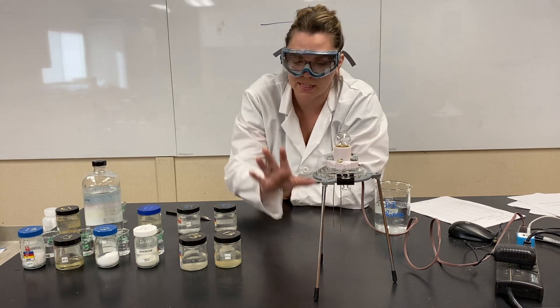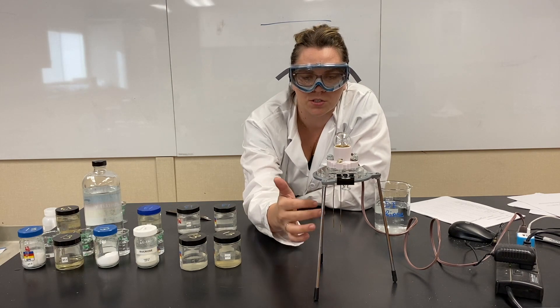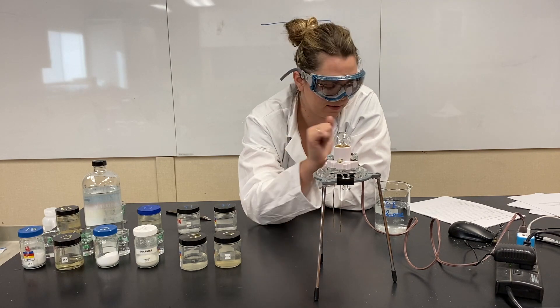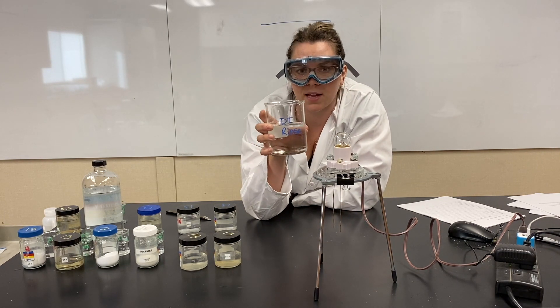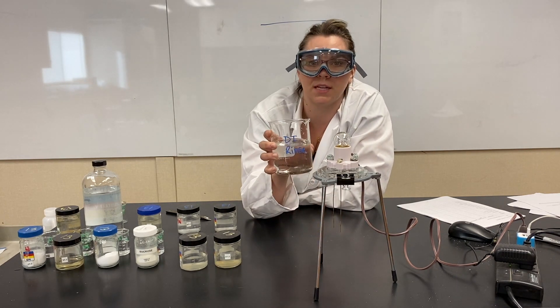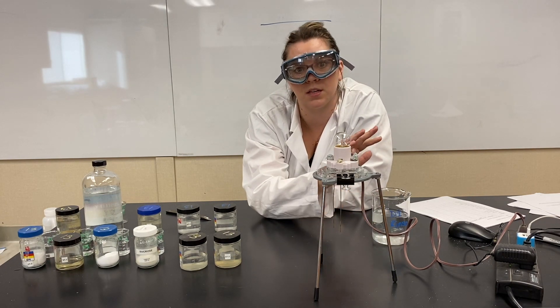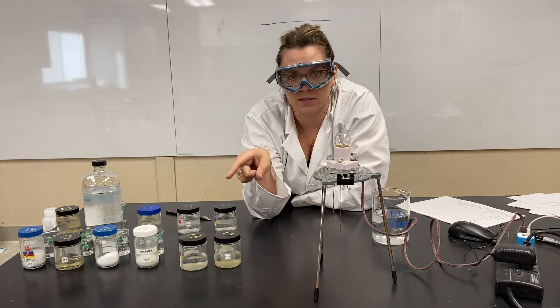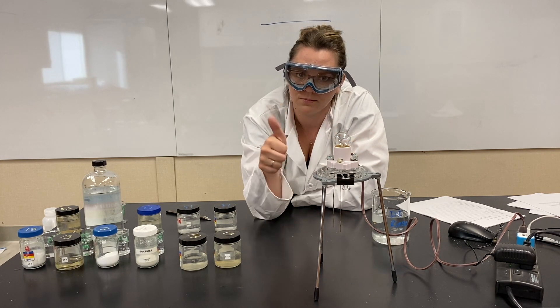I will say between each and every trial, what we do is we give a DI wash to our light, to our circuit. So we have the DI water rinse. So just after every single trial, we'll put some DI water onto the electrodes to make sure that our next trial isn't contaminated by our previous trial. Let's do it.